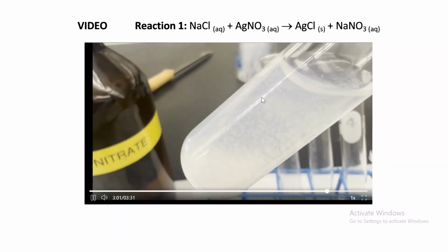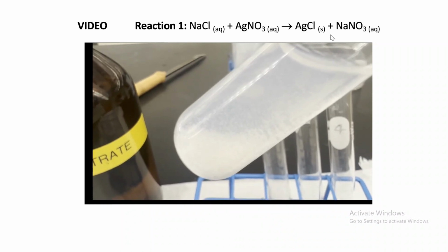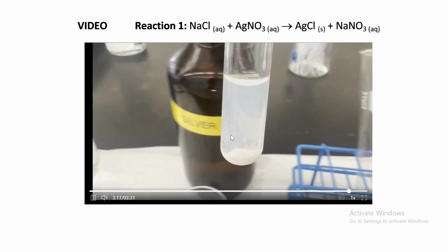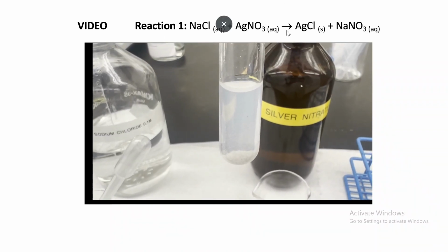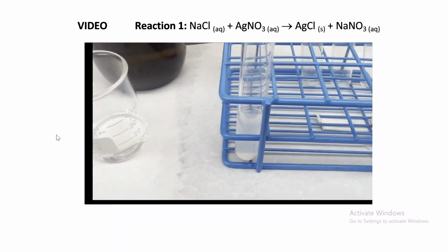So this is a precipitation. Is this physical or chemical? That's a chemical reaction. So we're mixing two colorless liquids, and as a result we're getting a solid silver chloride. Look at that. The solid is precipitating to the bottom because it's more dense than water. So reaction number one is a chemical change showing us a precipitation reaction. Two liquids becoming a solid. Very good. Make sure to write down all the observations of all the reactants and fill your data table.